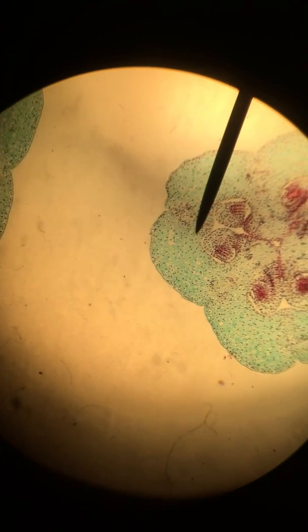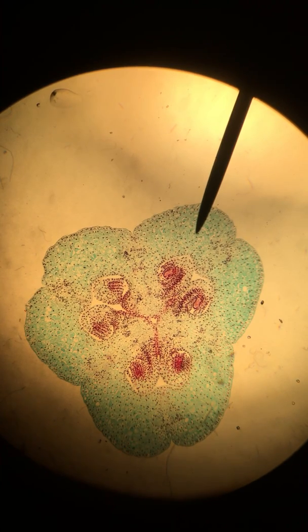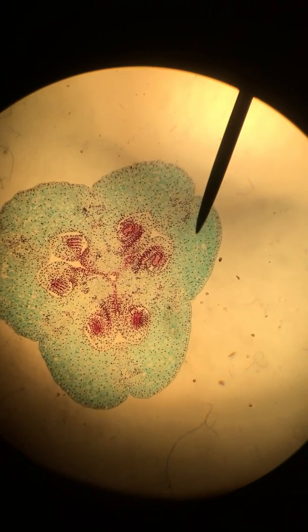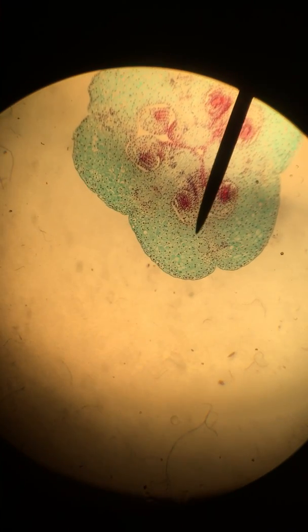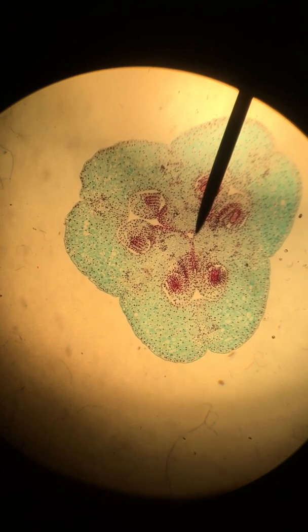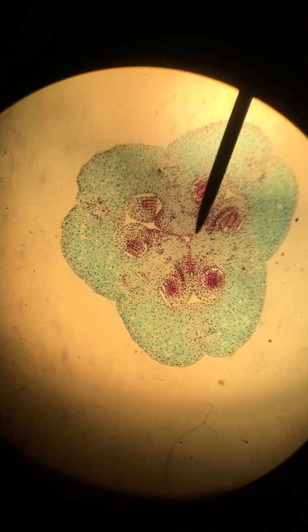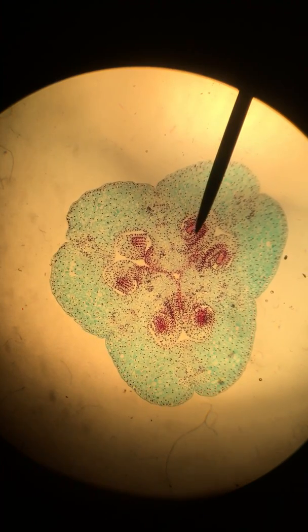The ovary is at the very base of the pistil. The stigma is at the top, the style is in the middle, and the ovary is at the base. Inside the very center is what we refer to as the placenta, which is the center part of the ovary where our ovules will attach. And these are the ovules.